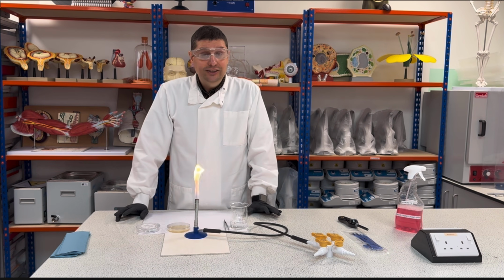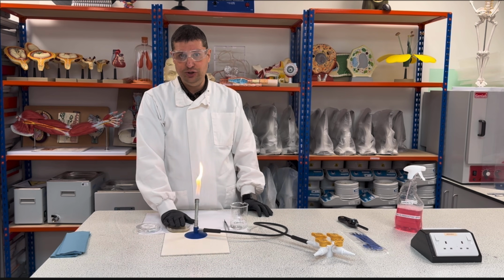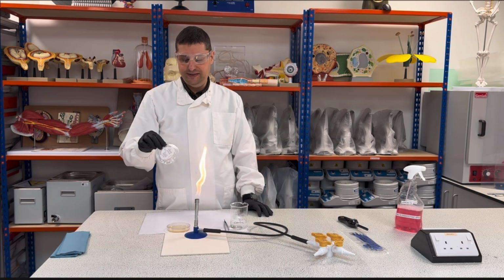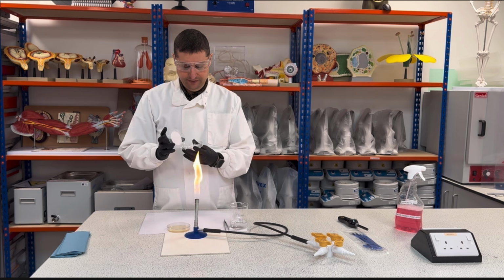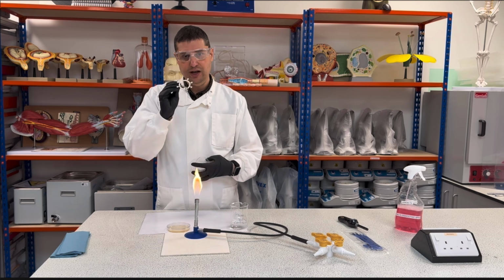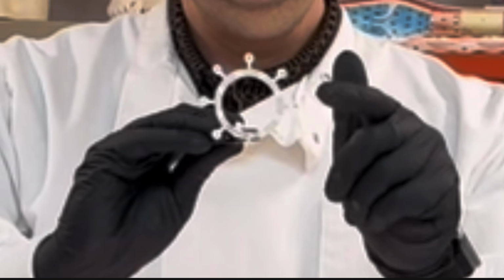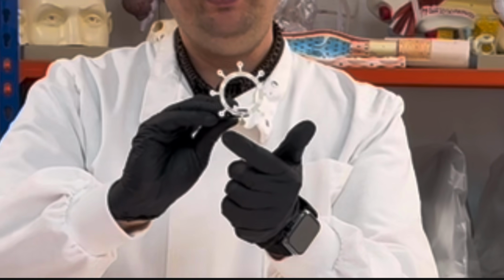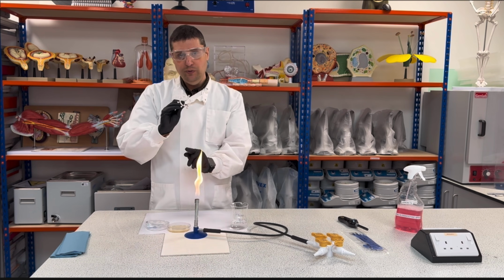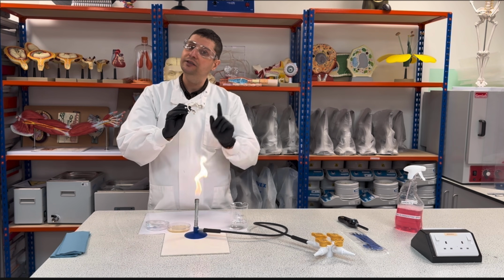Okay? So for this second part, I will have my bacteria already inoculated, and then I will use my antibiotic discs. I will take one here, and I will show you how this looks like. Okay, so this is antibiotic disc. So each one of these parts outside is one kind of antibiotic. We're testing what antibiotic might work with this E. coli and which one not gonna work.